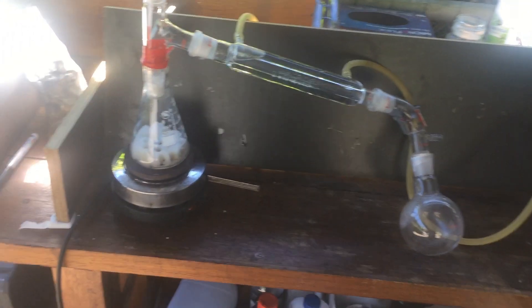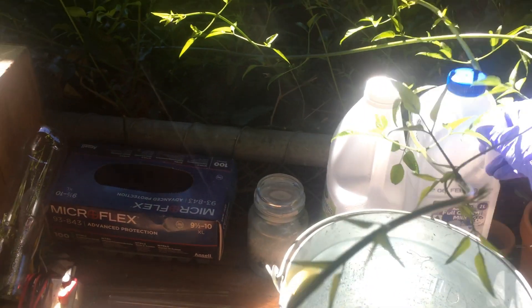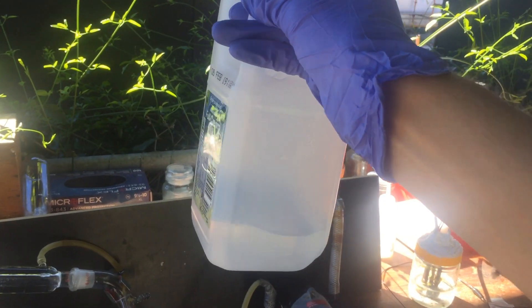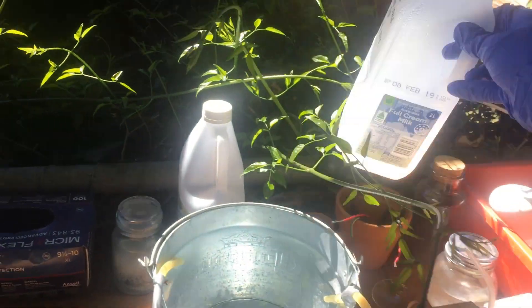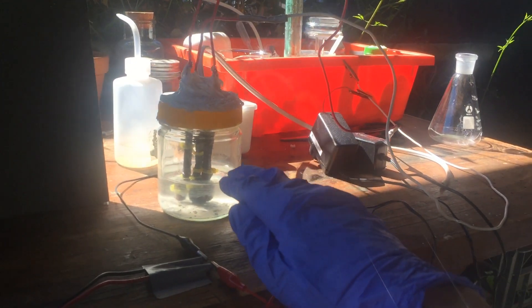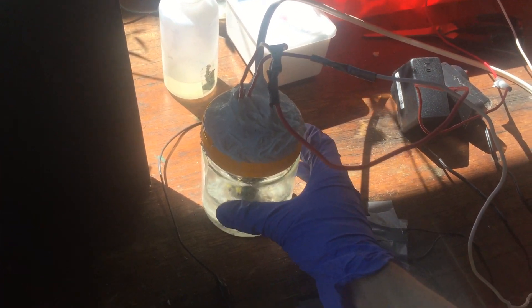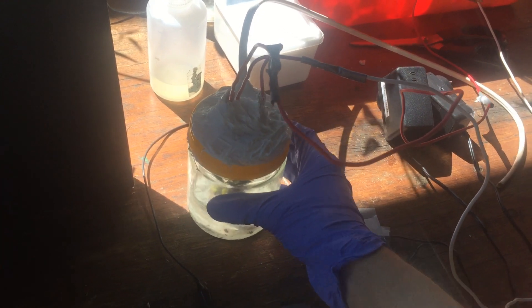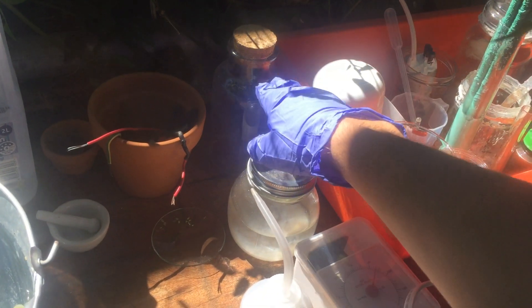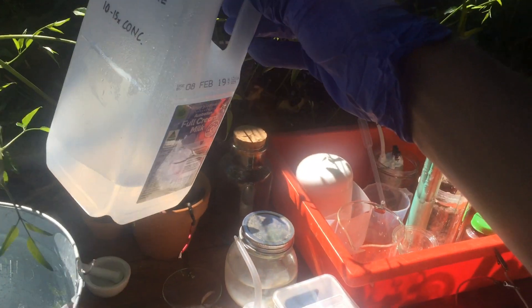We are now at the stage where we have distilled the majority of our concentrated heavy water. Hopefully around 400 millilitres in there, and with another 400 millilitres that I've had, I've just concentrated that down to half of what it was. So here we have our first batch of what is hopefully approximately 20 times concentrated deuterium in water — that's pretty cool. I'll go ahead and put that in this container and we'll set up another batch and concentrate down this stuff as well.